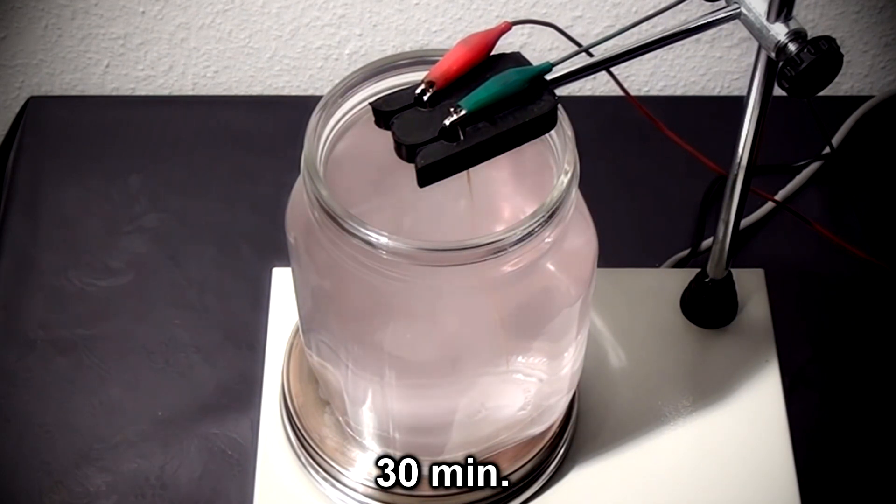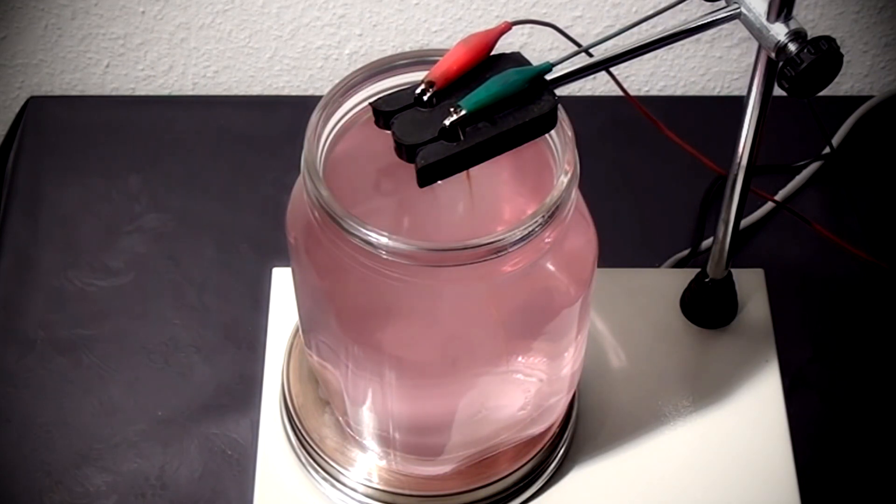Now the color begins to look like something. But it's not enough. It must be ruby red.